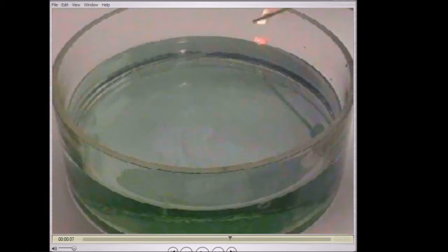Now if you heard that, hopefully it came up in the video with a squeaky pop. Okay, now that should tell you which gas is produced in this reaction. That will allow us to fill in our missing gap in the previous equation. So the gas is indeed, of course, hydrogen.